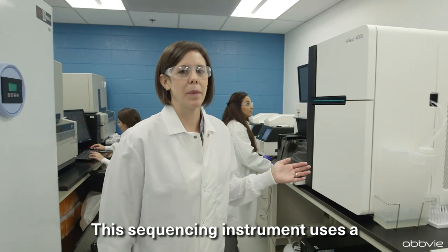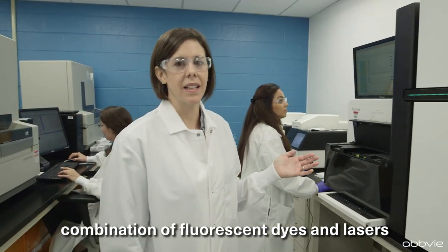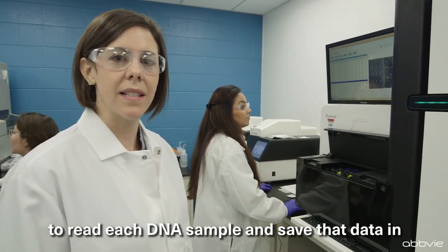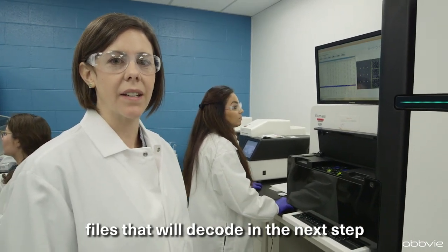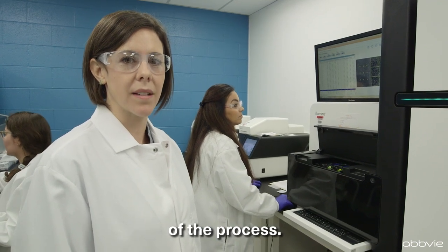This sequencing instrument uses a combination of fluorescent dyes and lasers to read each DNA sample and save that data in files that we will decode at the next step of the process.